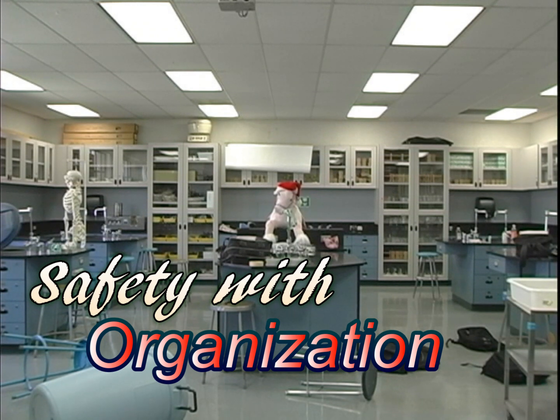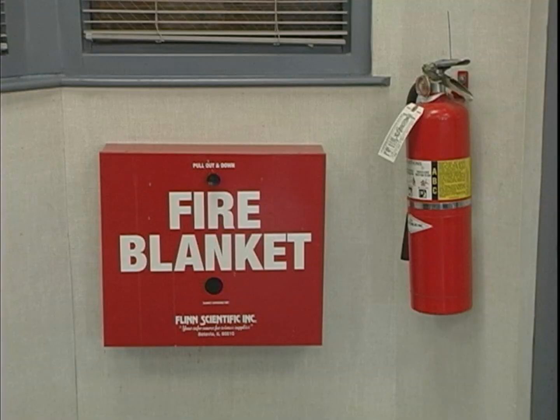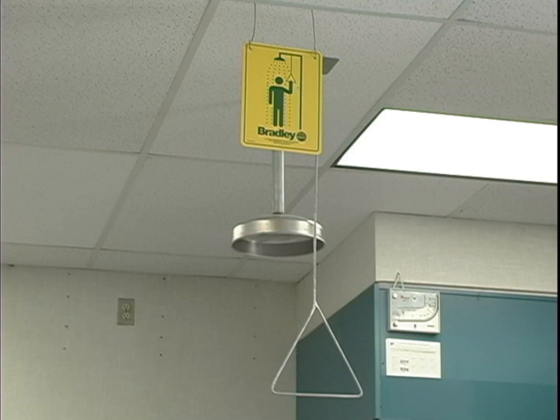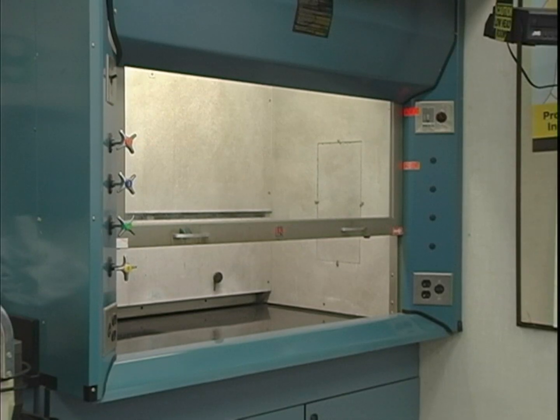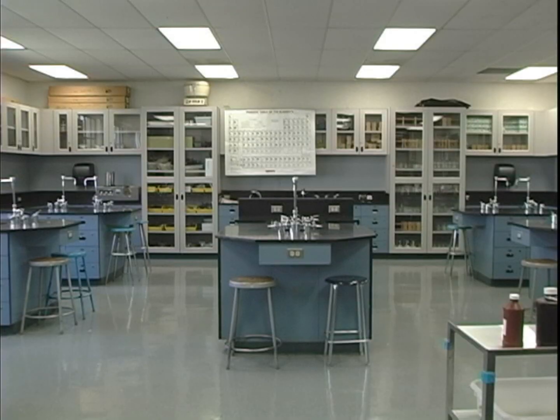Even after the accident happened, Carol still could have saved her vision if she only knew where the locations of the safety equipment were. The fire blanket, fire extinguisher, safety shower, eye wash station, and fume hood. But this could have been prevented before if all this clutter had been cleaned up.